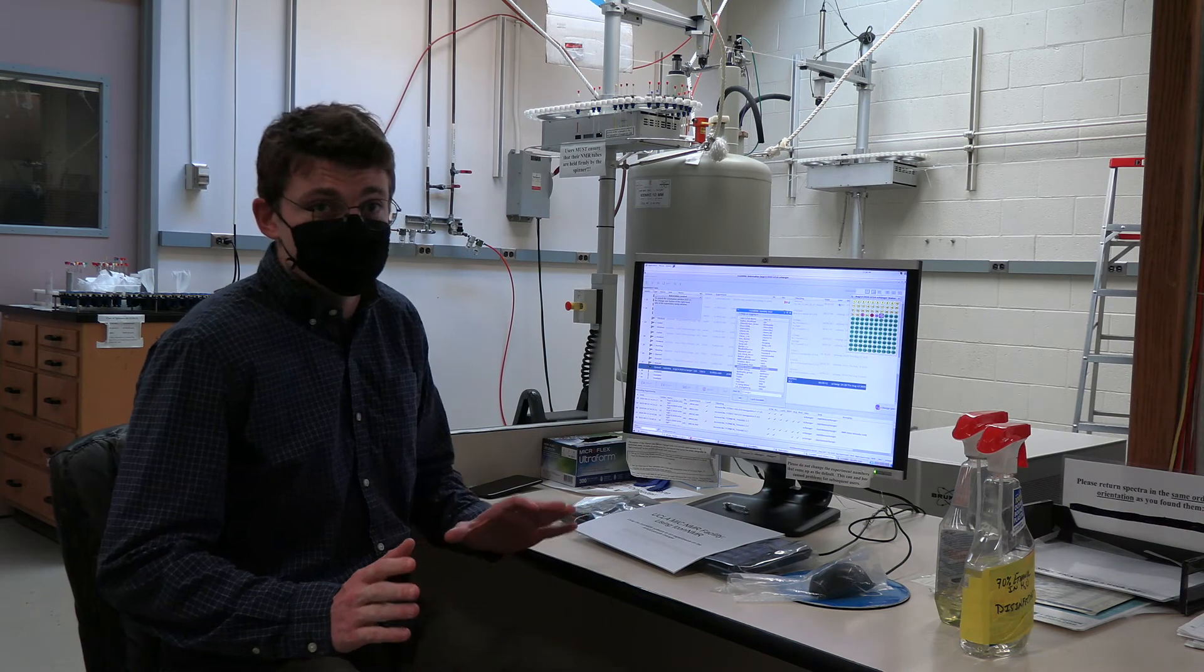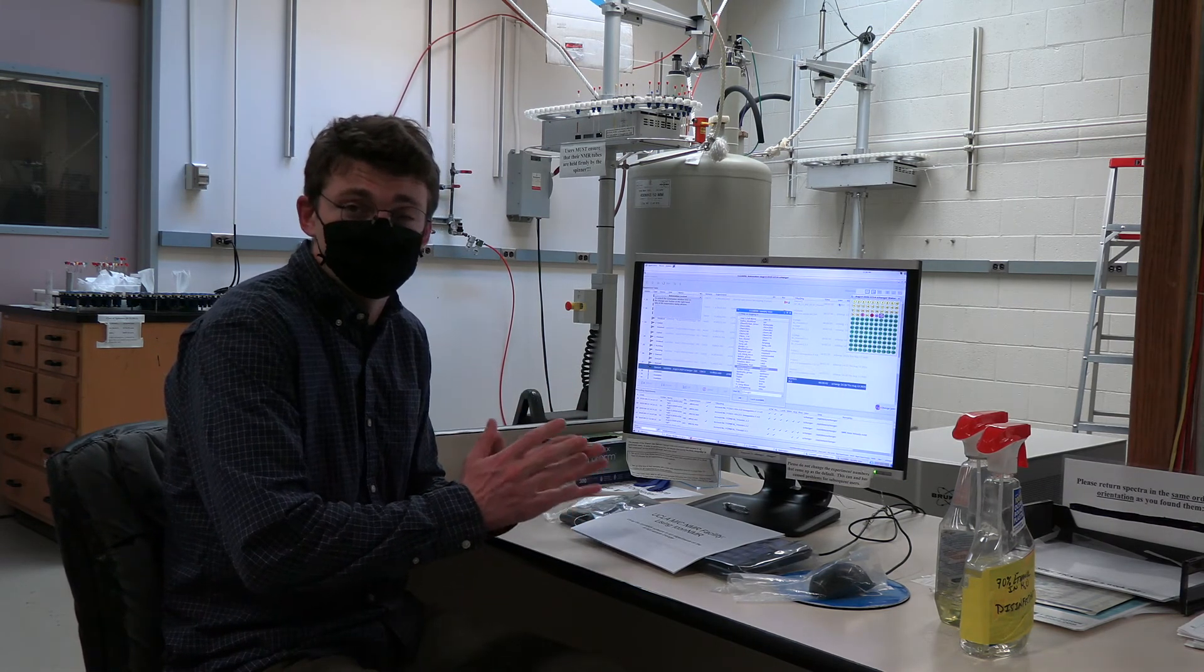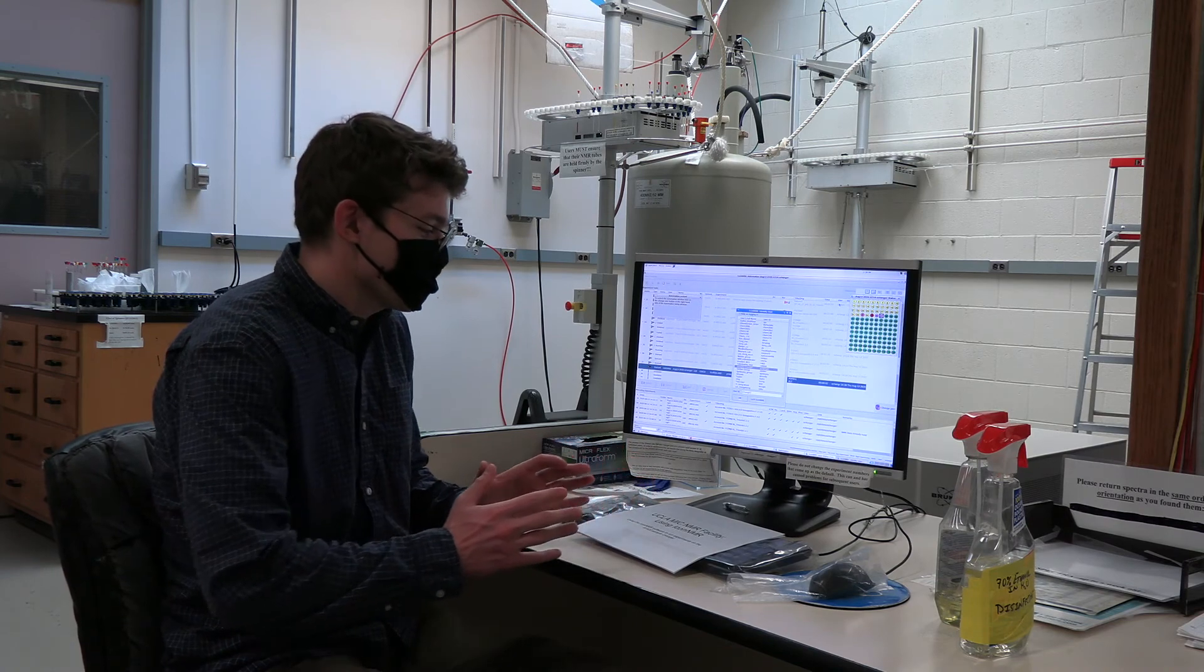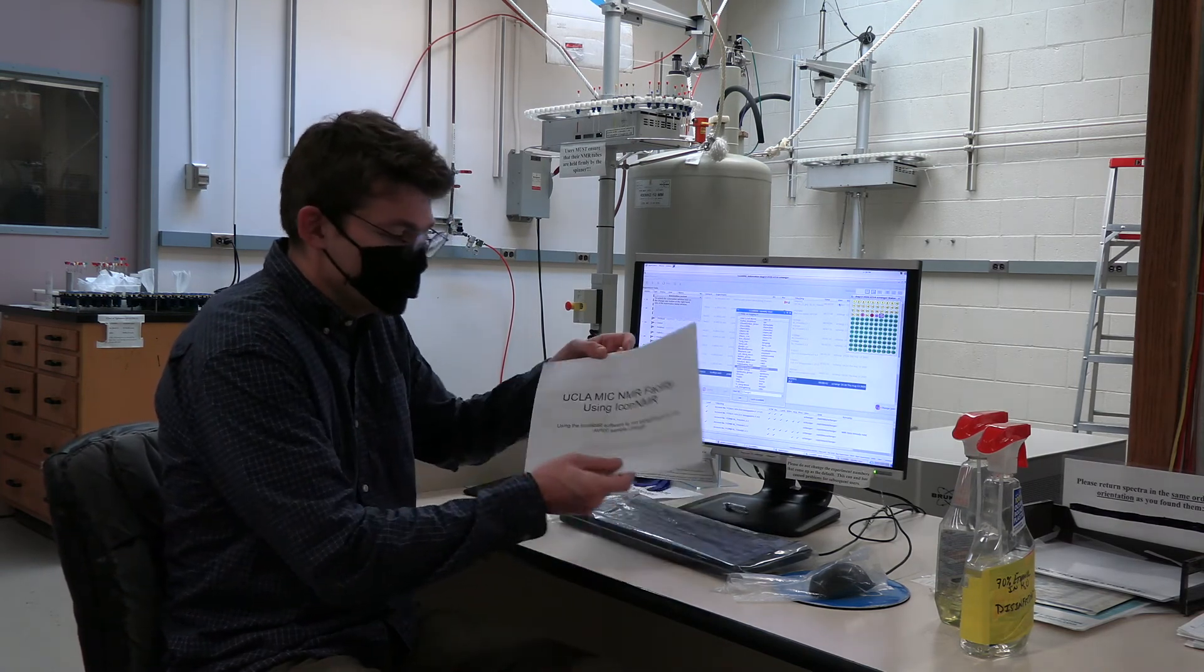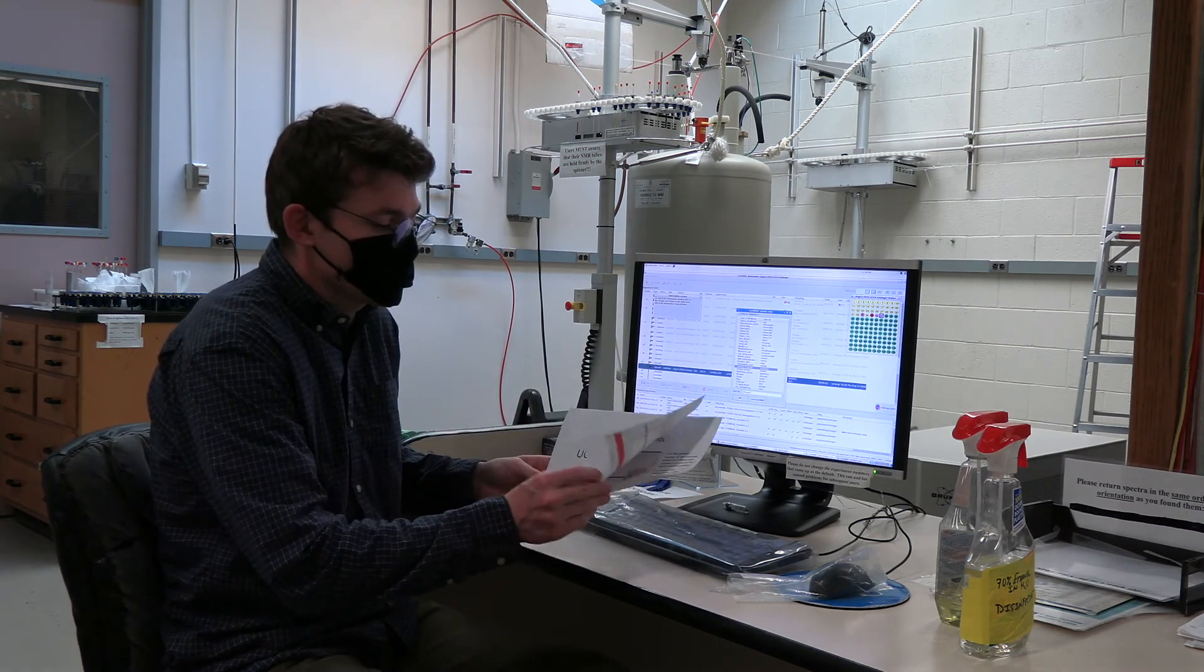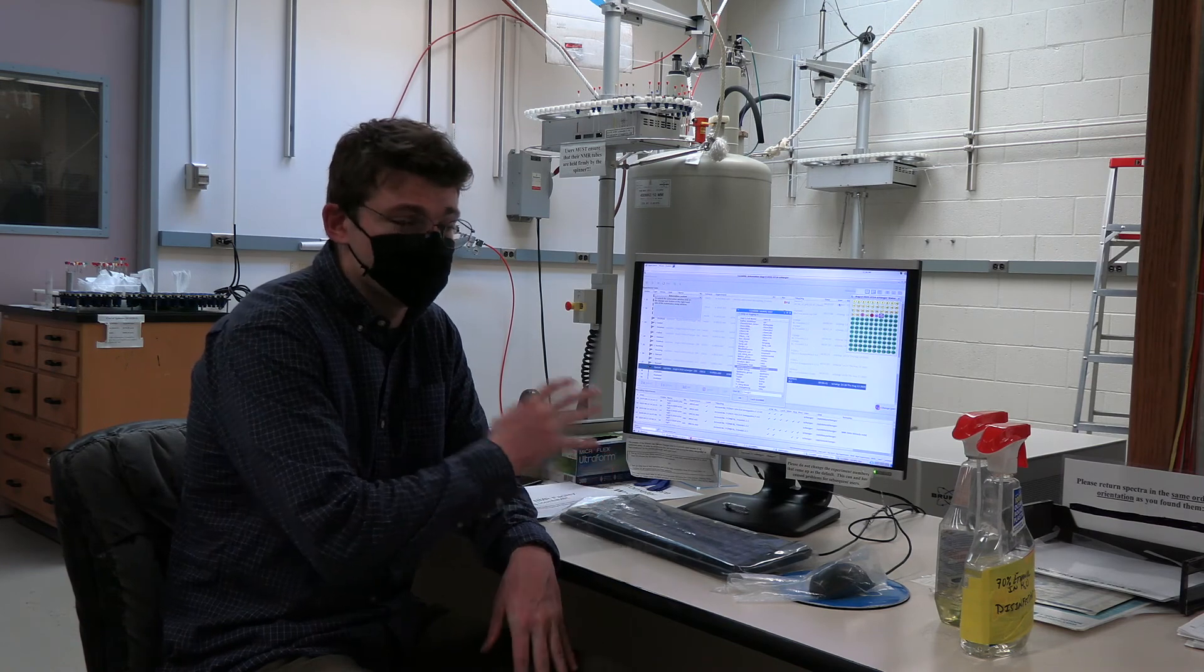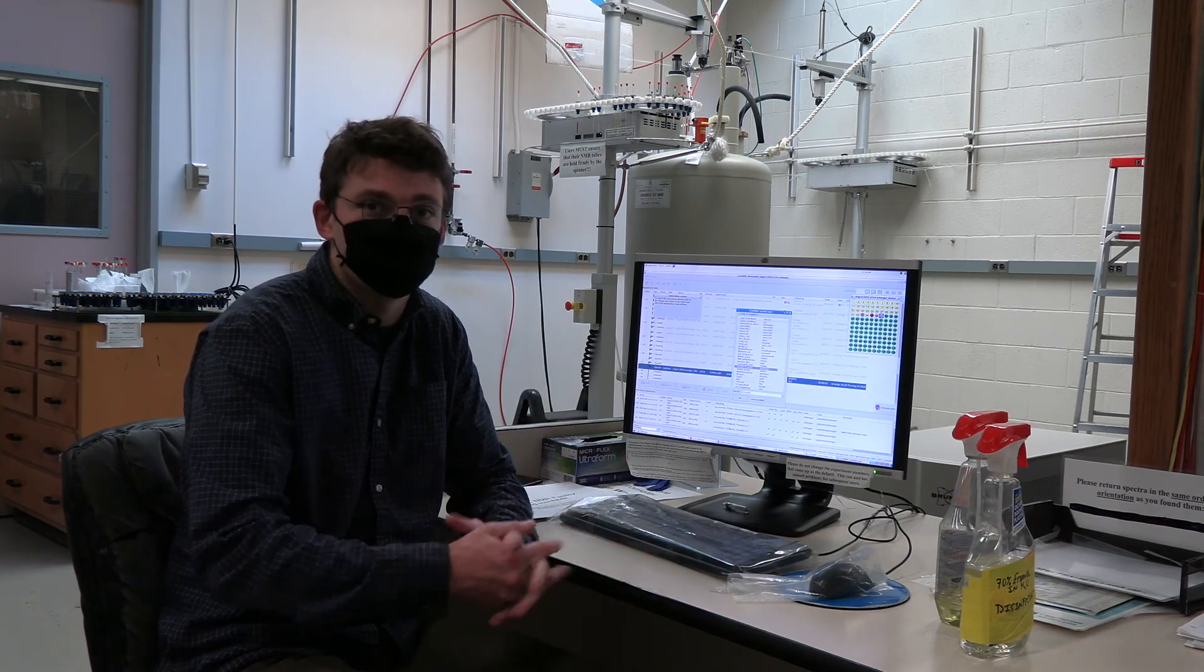So the last step is entering all your information into the sample changer software or ICONNMR software. To do this we have created a packet with step-by-step instructions on how to interface with the software, set up your sample, and any experiments you wish to perform. If you have any questions you are more than welcome to contact Bob, TC, or myself. In addition we will be going over this portion in a bit more detail during the in-person training so we can address any questions or concerns that do arise.